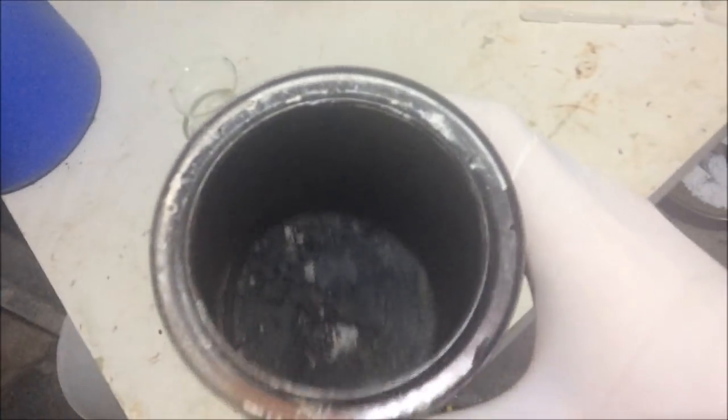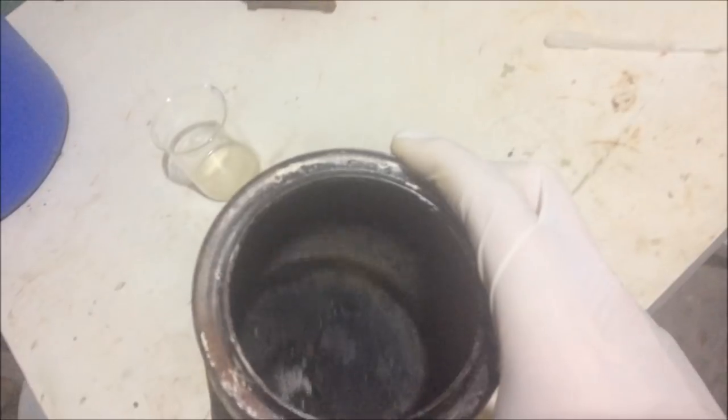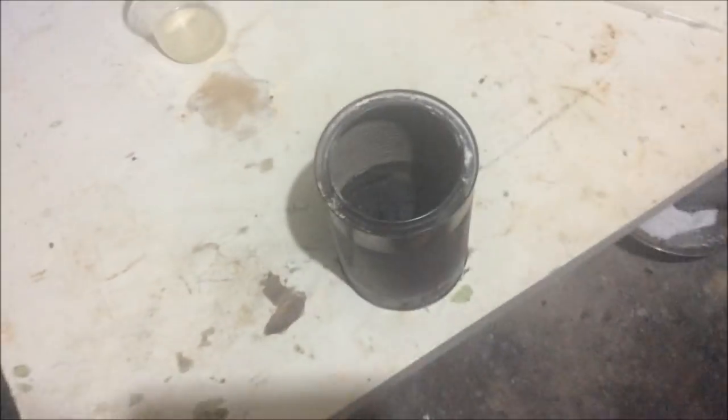Here is all our carbon. Get the light right. Char. Organic char. Carbon. It smells terrible. So I feel like I shouldn't really have all this char, which implies that maybe I was heating it too hot, which I can blame on not having a hot plate. So thanks, Westlab. But yeah, it's a bit of a shame.